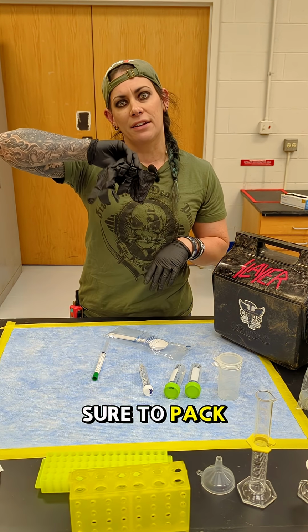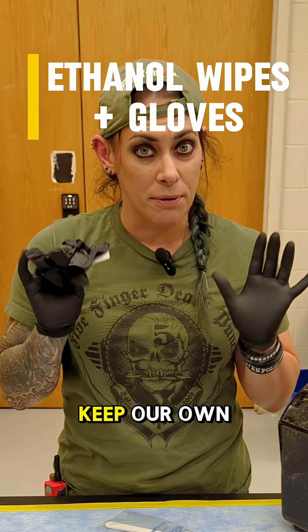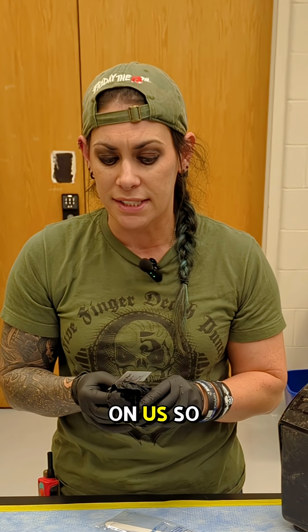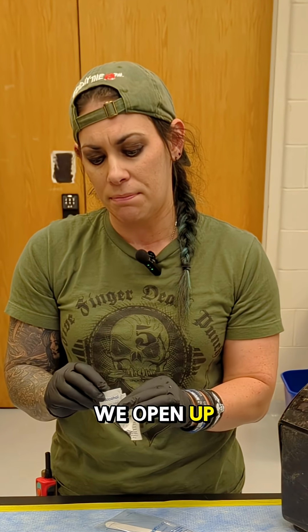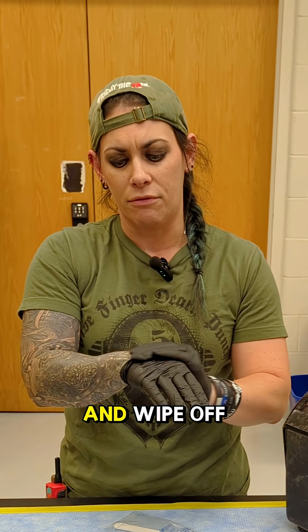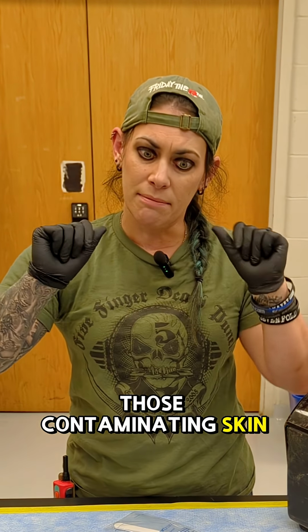One of the most important things we have, because we're a micro lab and a biomedicine lab, is we make sure to pack gloves and ethanol. This is to keep our own skin microbiota from getting into our samples. We want to know the samples in the environment, not the samples on us. So we throw our gloves on before we do anything else with sample kits. We open up the ethanol pack because when you're putting your gloves on, you're touching your gloves, so it's already contaminated with skin cells. And wipe off those contaminating skin biota.